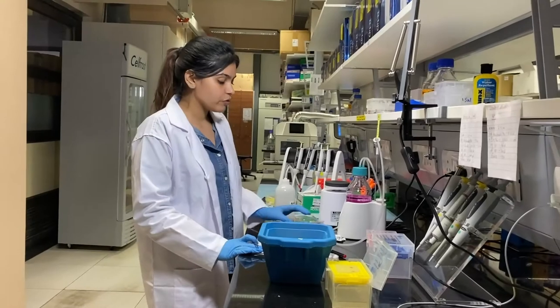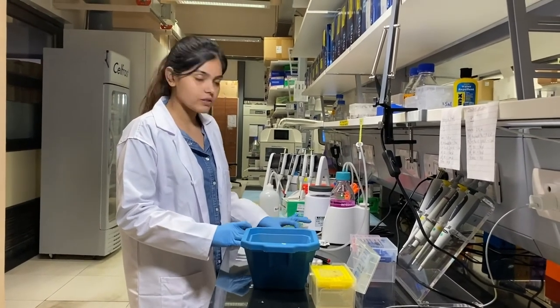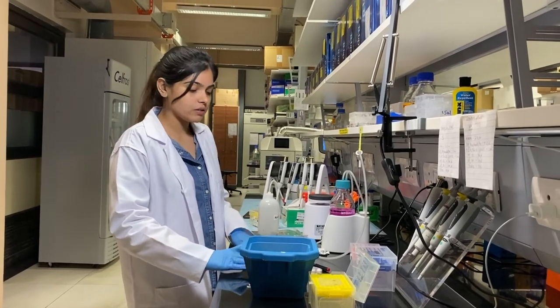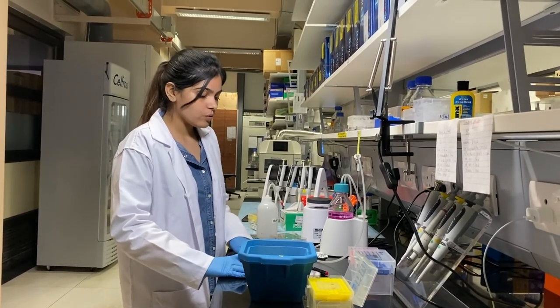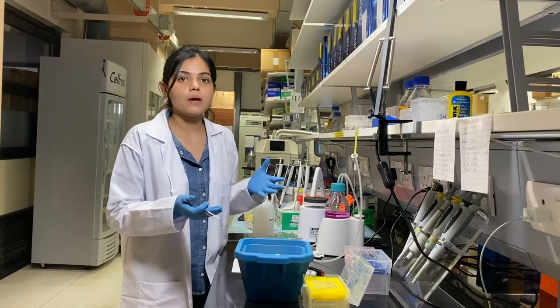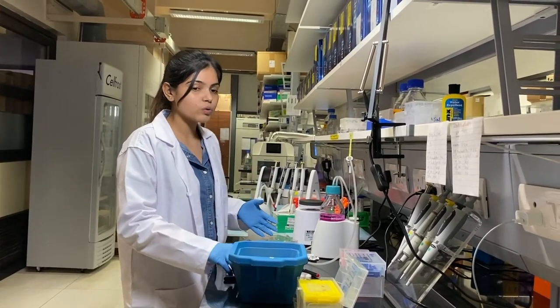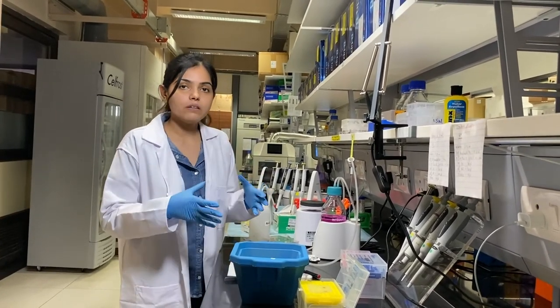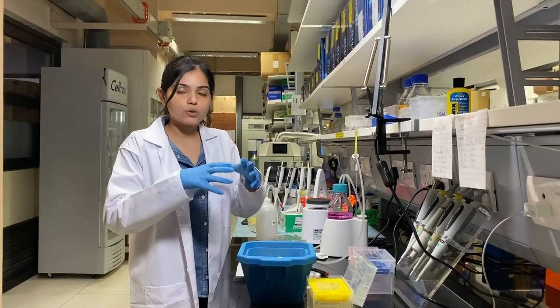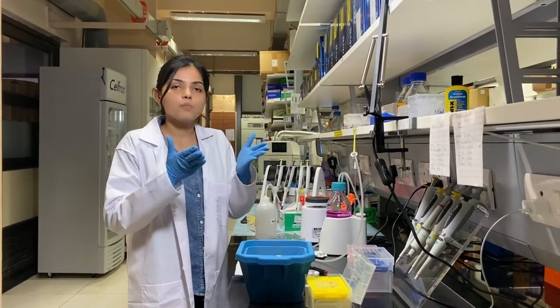We are going to keep the cells with the fixative for 15 minutes, then wash and move to the next step, which is embedding. After 15 minutes, we have washed the cells, taken out the coverslips, and placed them here. Now we move to the embedding step.